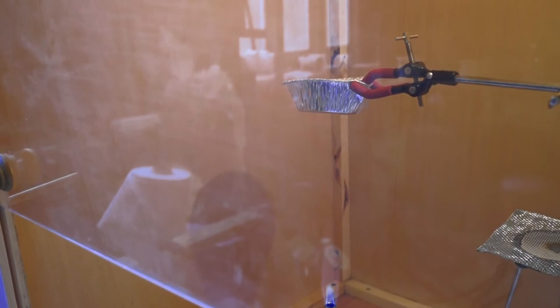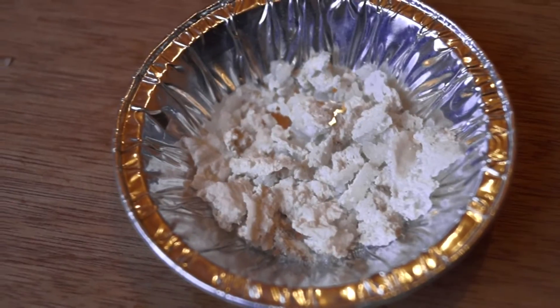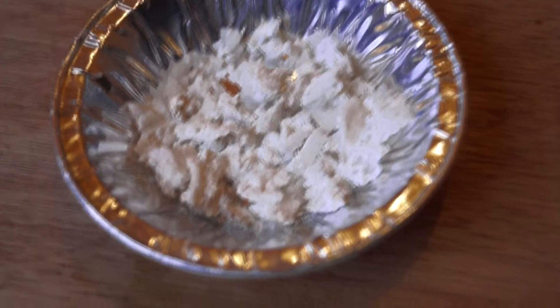The sodium acetate must be completely and thoroughly dried in order to make glacial acetic acid as any water will become difficult to separate from the final product as it forms an azeotrope with the acetic acid.